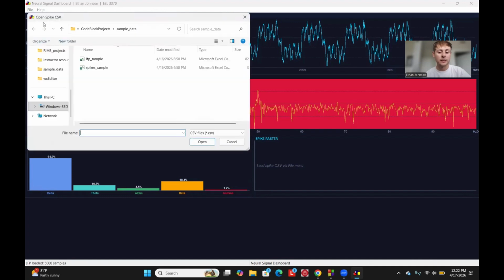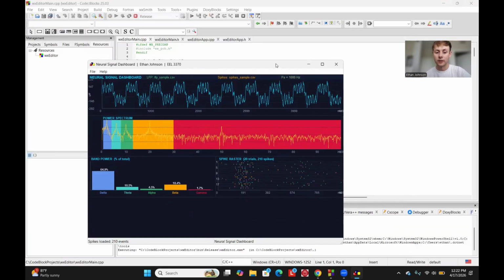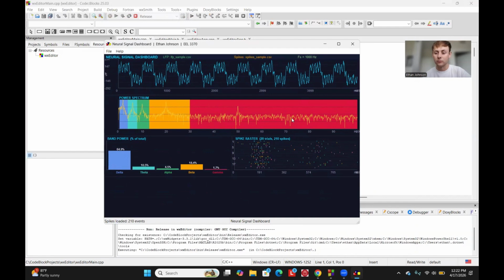And then we'll load the spike CSV. And now we can see here the spiking activity. Again, it shows how many trials and how many spikes are in there, and we also see that updated down in the left-hand corner. We see that it looks like it's spiking around 191 and a little bit over here as well. Also with this project, the OnPaint function will update every time you resize the window or load new data, so it'll adjust to that as well.